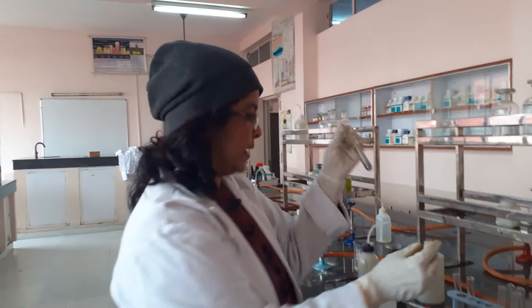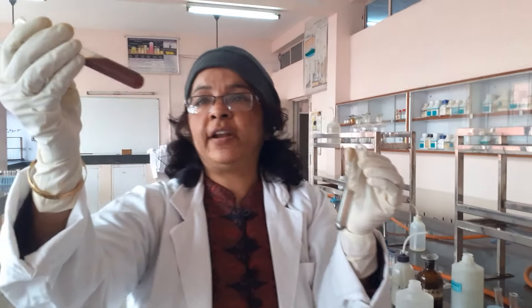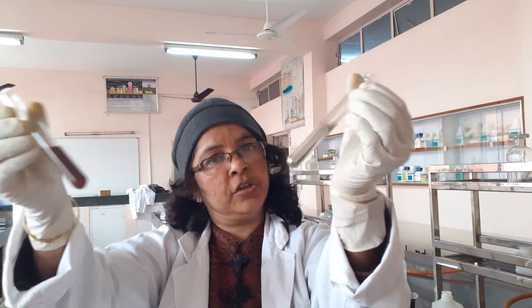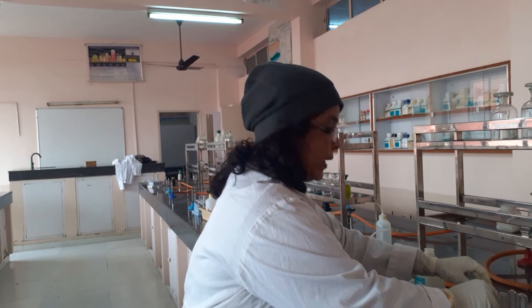So the two tests we performed were: Fehling's test, where the reagent changed to reddish-brown with an orange cuprous oxide precipitate at the bottom, and the Tollens' test, which gave a silver mirror on the test tube wall. These are the two tests for aldehydes, most commonly asked in practicals and viva. Be prepared for the viva and practicals. I hope you value the practicals of Class 12. Bye.